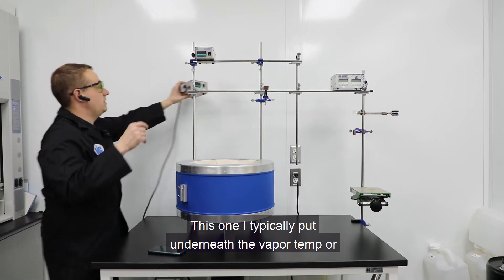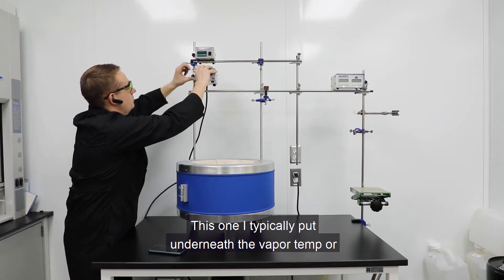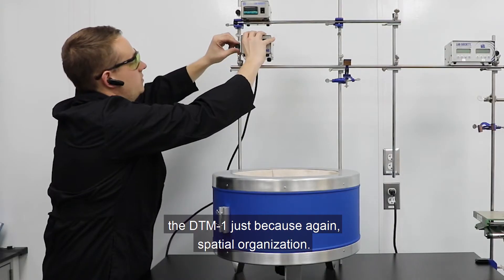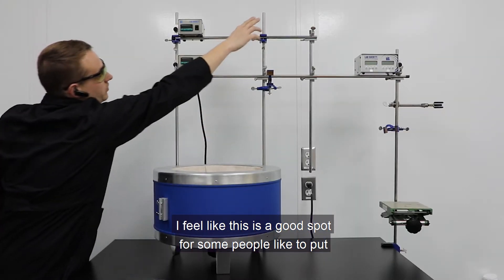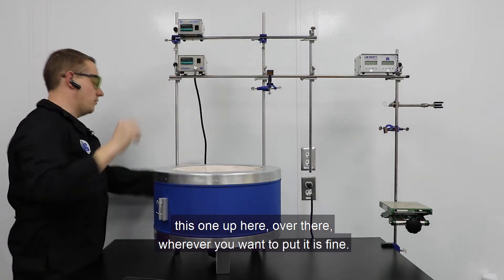This one I typically put underneath the vapor temp or the DTM-1, just because, again, spatial organization. I feel like this is a good spot for it. Some people like to put this one up here, over there. Wherever you want to put it's fine.